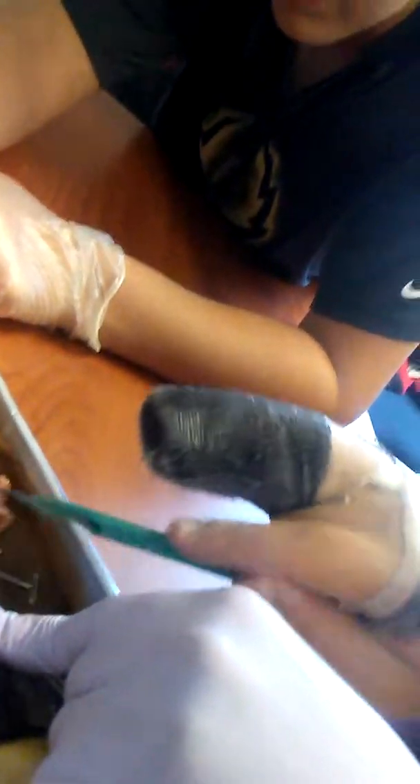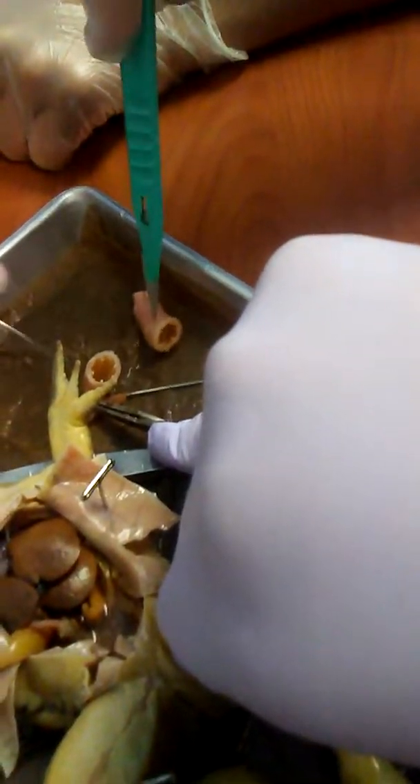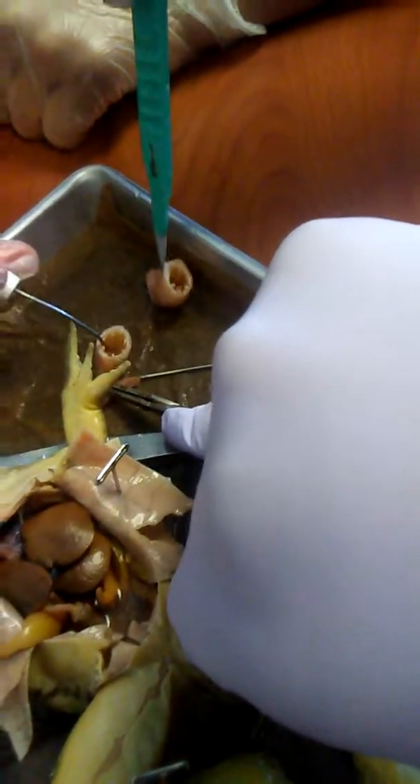I can't open that little part. There's inside — oh, this is probably gonna be flagged. This is gonna be flagged. Okay, let's see what's in there. I'll open this half, you look at that half. It's empty. Let me see the tweezers. It hasn't eaten anything — let me see the tweezers.